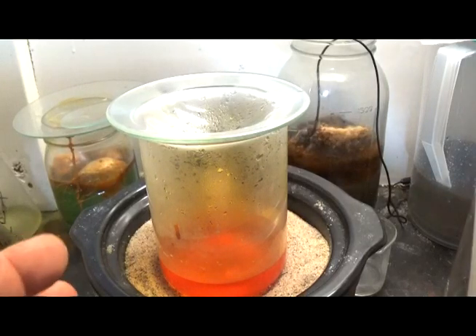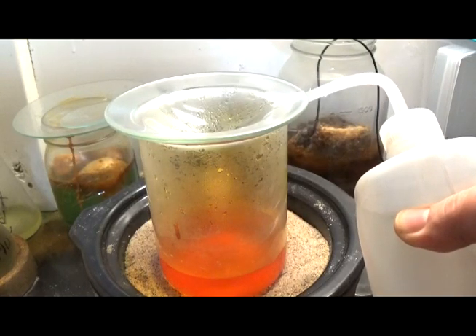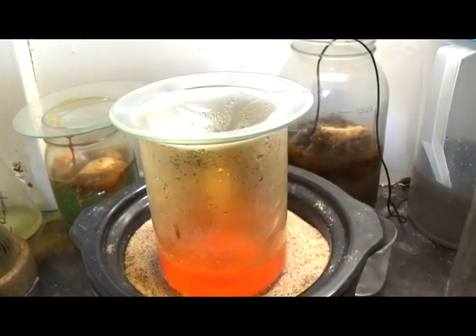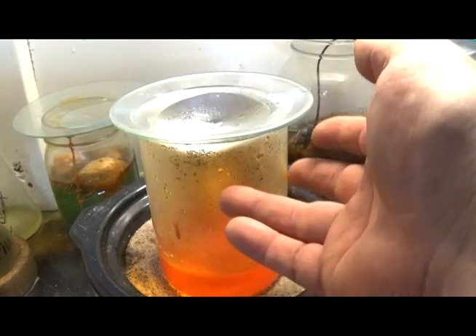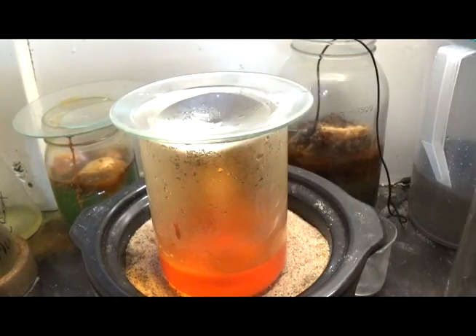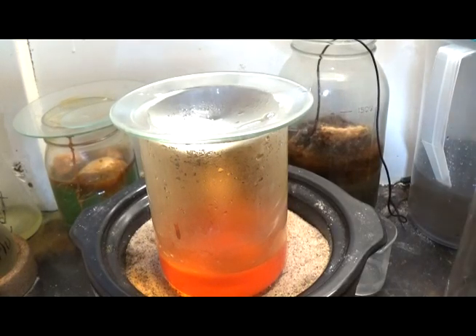Yeah, that's not bad for 8 milliliters of nitric. We're going to put about 25 milliliters of water in here. Let's give it some room to dissolve. But anyways, you can make a little crude distillation device where the nitrogen dioxide fumes come up and condense here, and drop back down as nitric acid. Works quite well if you put cool water in here. Then you stretch your nitric out a little bit more doing this. It really does work. So, that's not completely dissolved, but it's almost completely dissolved.